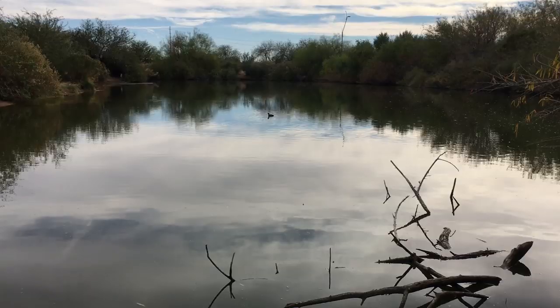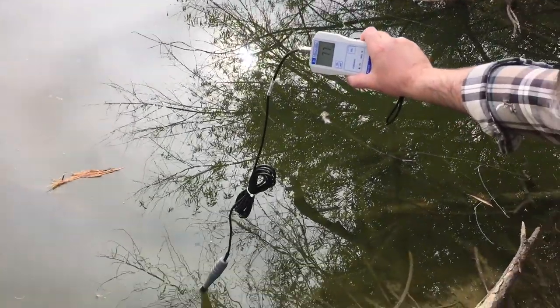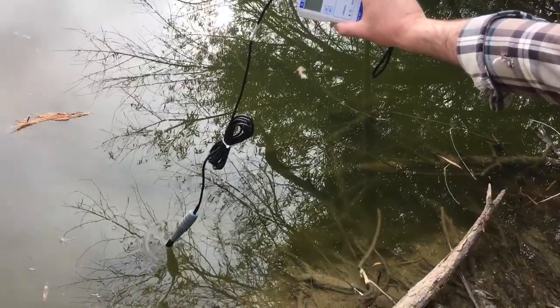So here's a pond at the riparian preserve and over here I have my husband taking dissolved oxygen reading of the pond.